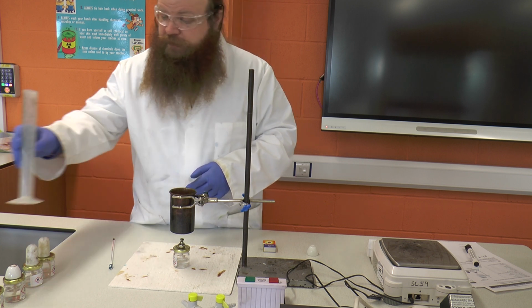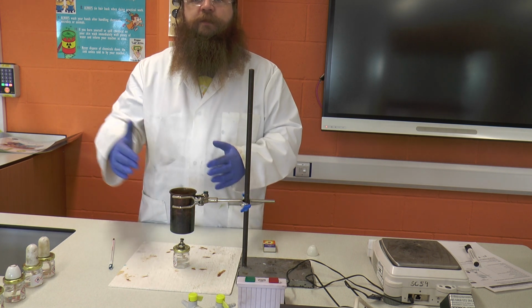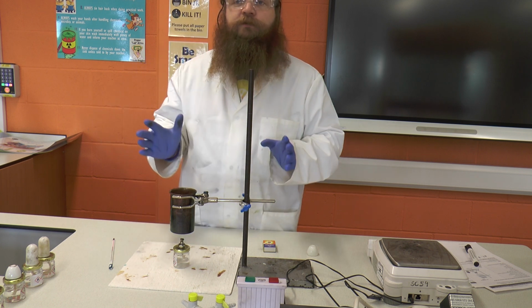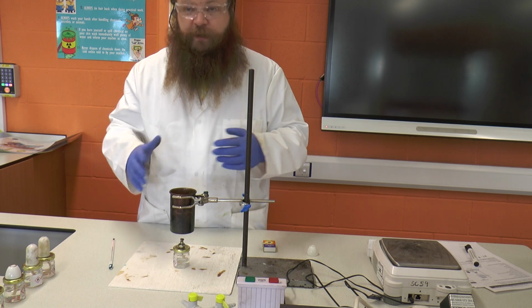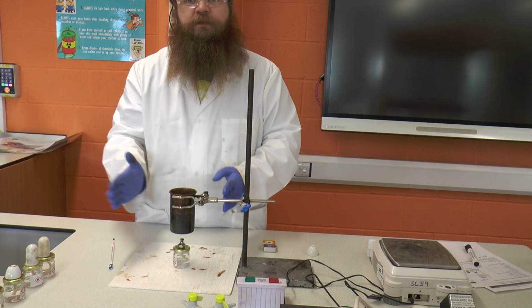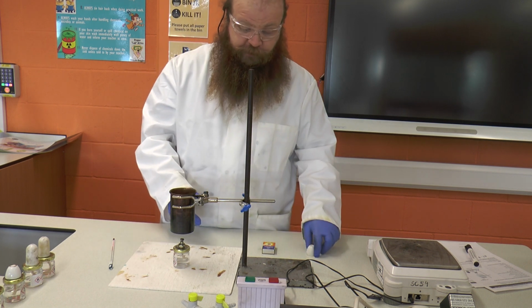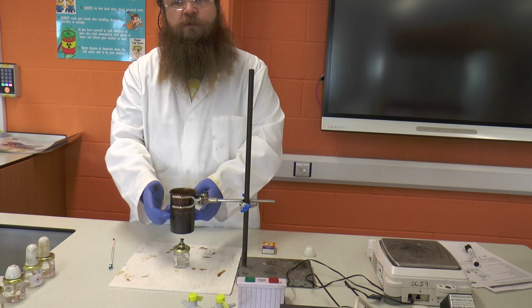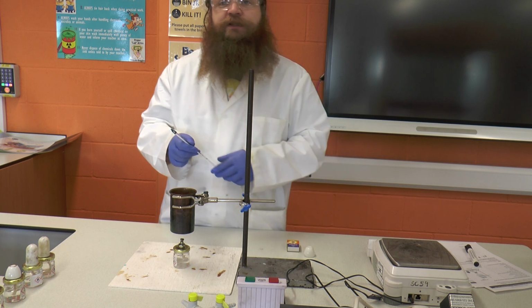Now if we were in a windy or drafty space, we may wish to put windshields to stop any draft blowing the heat or the flame away. We're fortunate today to be in a nice quiet, calm, still room, but if you were in a lab with a lot of people moving about or a lot of windows open, you may wish to place extra mats around to prevent heat being blown away and escaping from our experiment. Because remember, we want all of the heat from the burning of this alcohol to get into the water in this can.